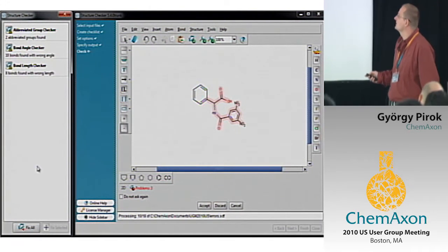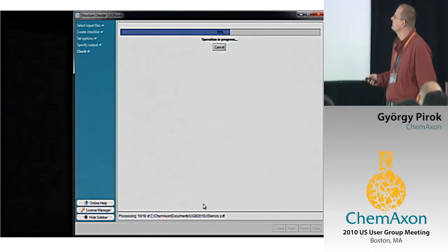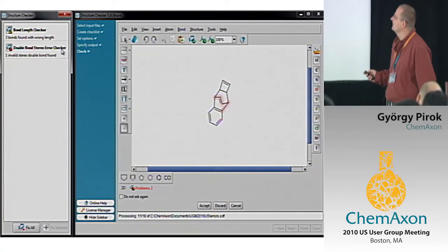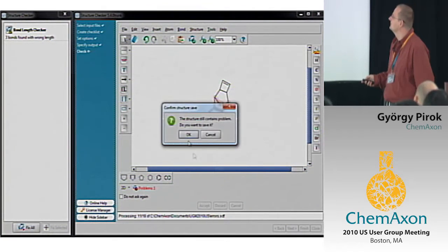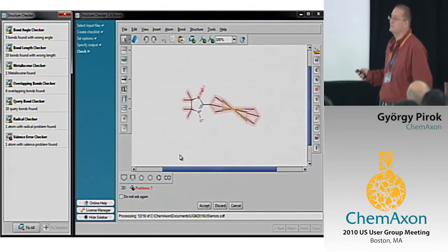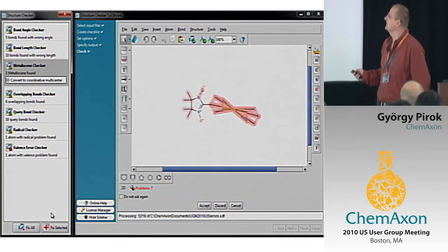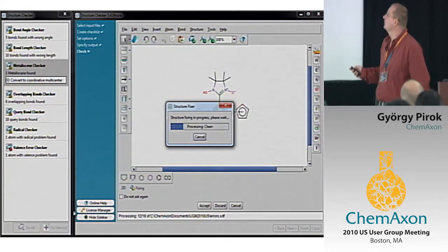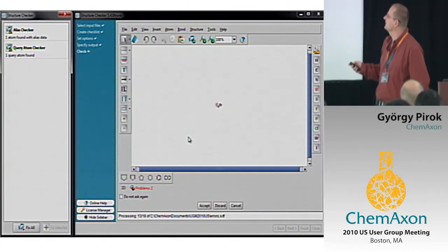Here we have NO2s and abbreviated groups, and some bond angle problems. This is a trans bond in a small ring. So we warn in this case. I manually correct here. It's okay for me, so I accept. Very typical issue, one kind of ferrocene form from a database. There are many. We have a metallocene checker which recognizes all of those we are aware of and converts it to a coordinative format. There were some radical issues as well, so many things corrected here.